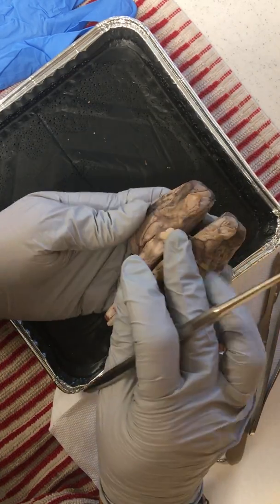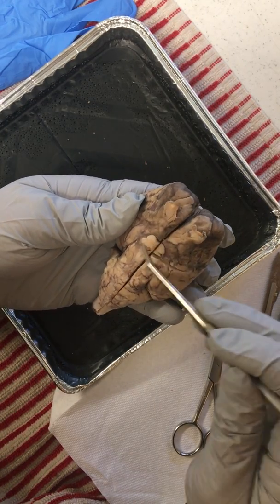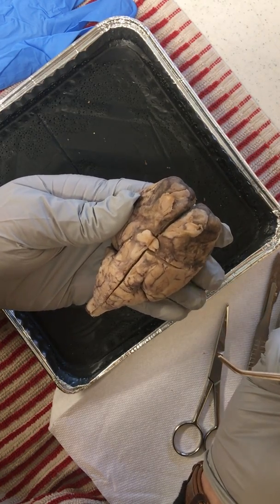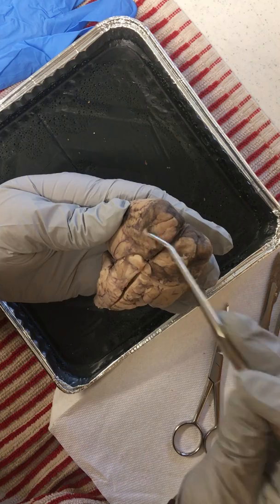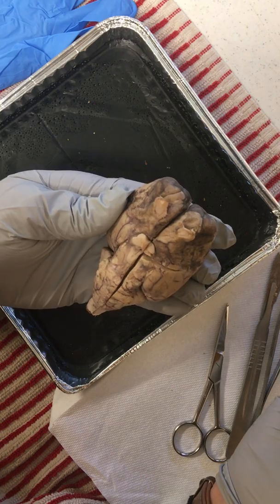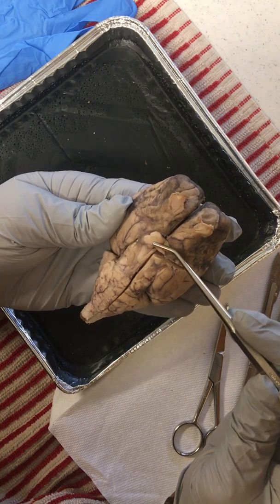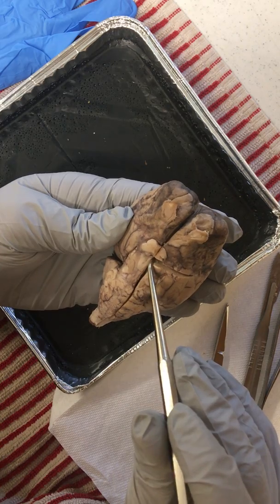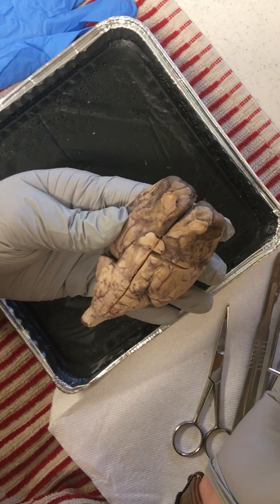The ventral view, the inferior view of the sheep brain, shows our olfactory bulbs and our optic nerves, this optic chiasm, which crosses those nerves, that right and left optic nerve, also known as cranial nerve 2. We have sheep on our homestead, and if you know anything about them, they're not the smartest creatures on the planet, but they do have some great well-developed senses. And so these are some well-developed olfactory nerves and bulbs that then trickle down to our optic chiasm, optic tract, and right under that is where the pituitary gland normally is. That's been since removed, and that's also known as the infundibulum.